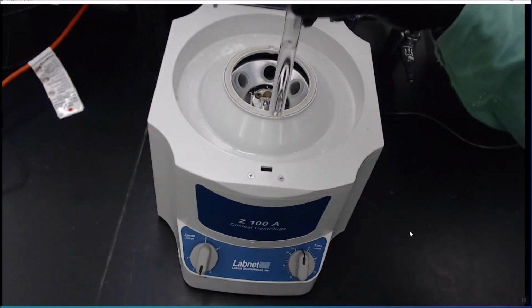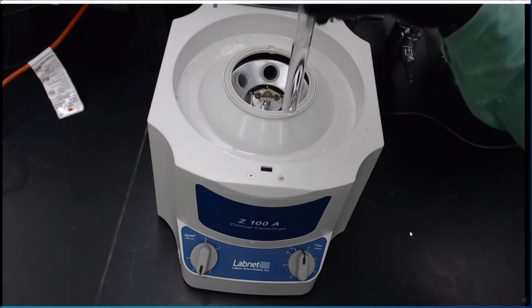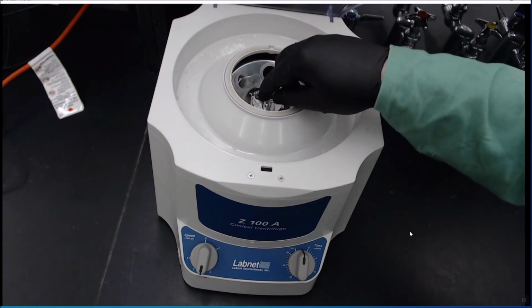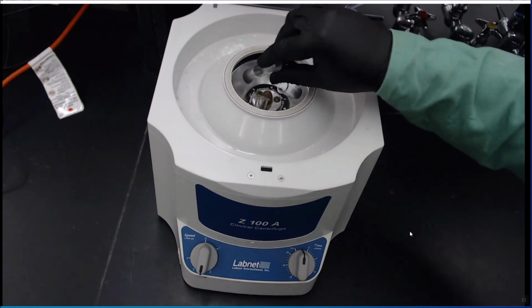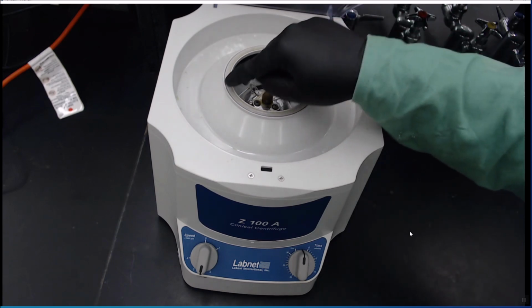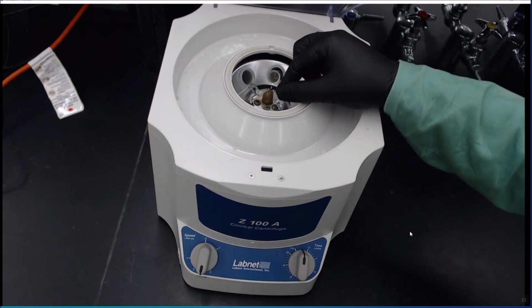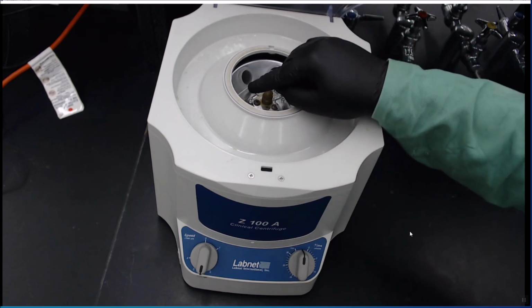So here, because I'm only doing 1 trial, you'll have 3. I have a test tube of just water. And I put it in the 3 position, and then in the 5 positions. So I have all the odds filled. There's also a 4, 6, and 2, so you can run 2 groups in this at the same time. As long as these points are equal, you're okay.